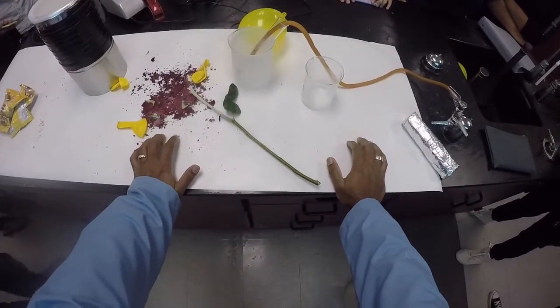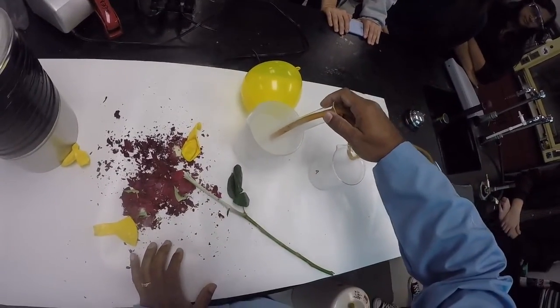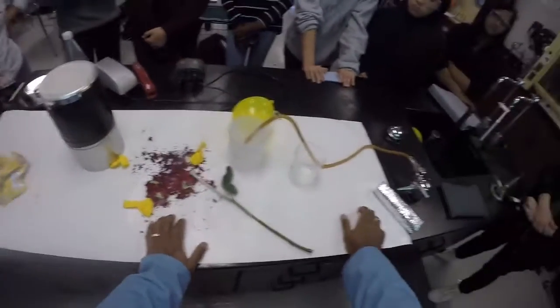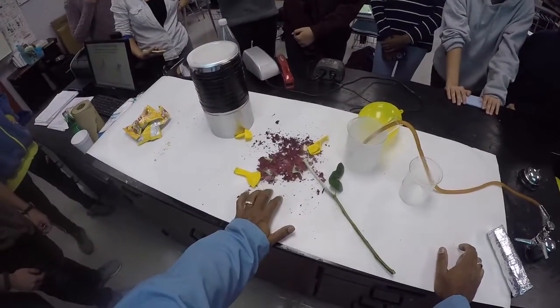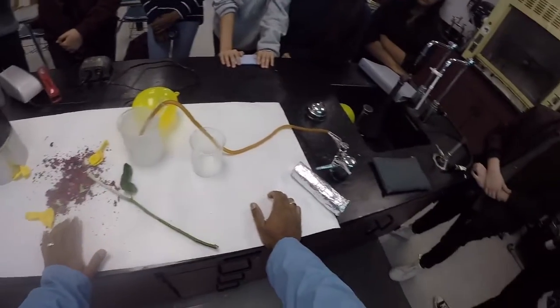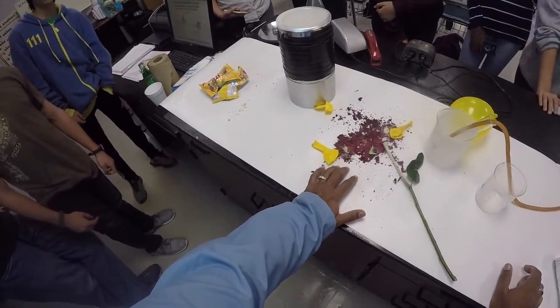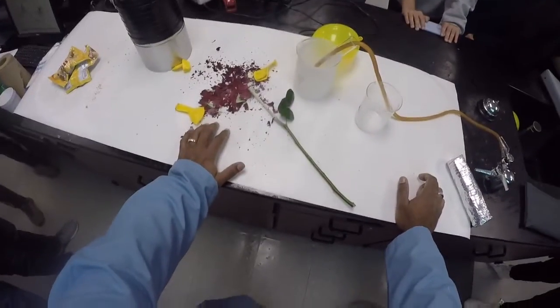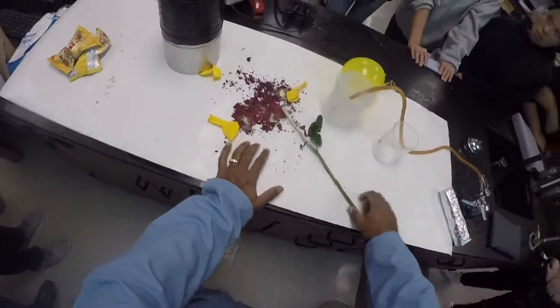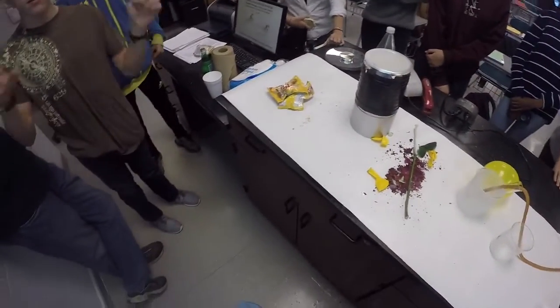But by the way, why does this happen? Why does it condense to a liquid while we're waiting? Anybody? Why does the gas condense to a liquid? On a molecular level, what do you think happens? It contacts the side of the test tube because the test tube gets cold from the liquid nitrogen. Right. It condenses onto the side of it. But why? There's less energy.